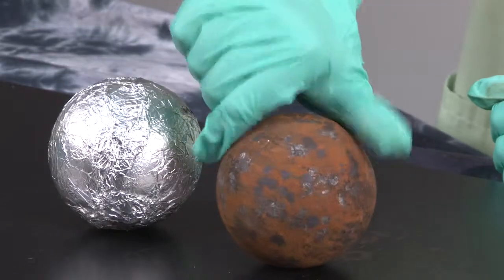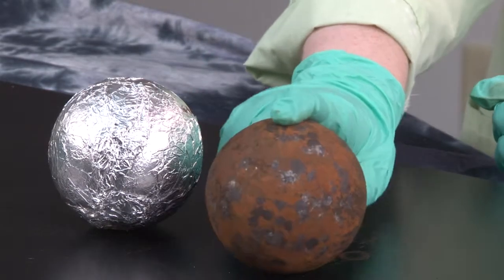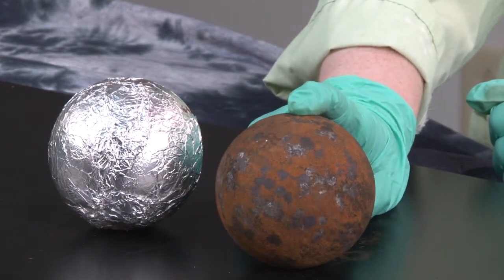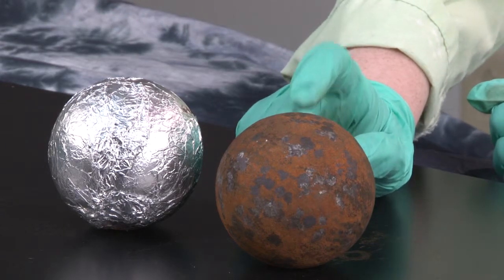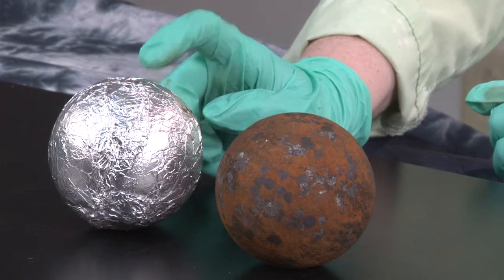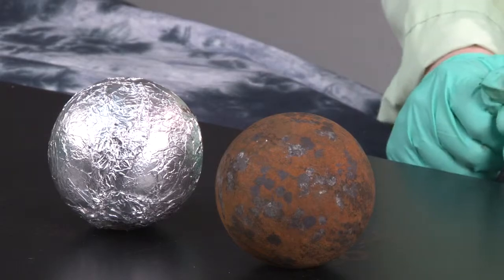As you can see, my cannonballs here have a very thin layer of iron oxide on them, and so only a very small amount of iron oxide can react with the aluminum metal, making this a safer way to do this demonstration.